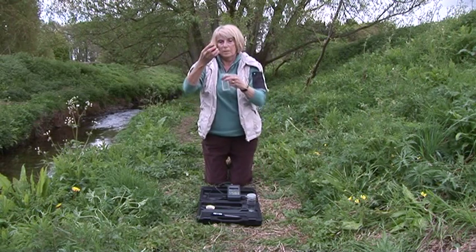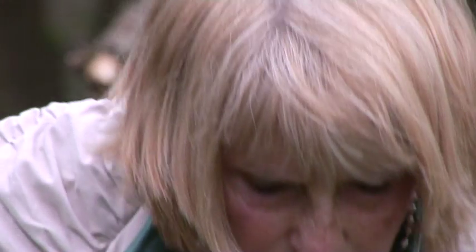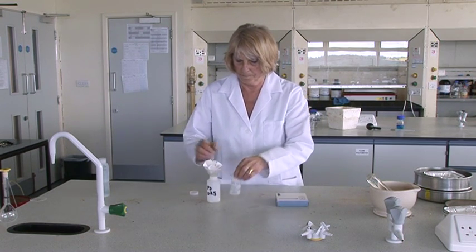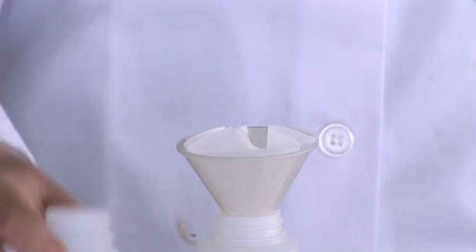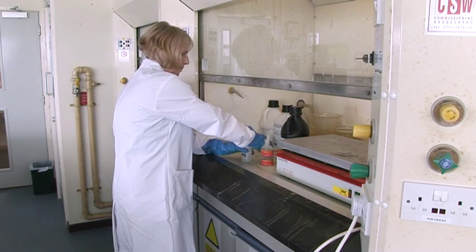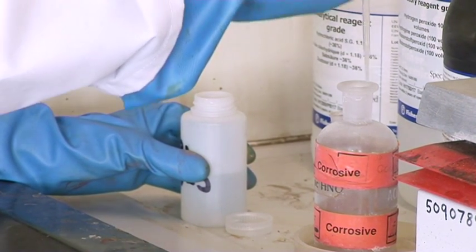A pH meter is used to determine the pH of the water sample. Heavy metals may be adsorbed onto particulate matter or other surfaces, therefore water samples must be filtered to remove any particulate matter. The acidification of the sample to less than pH 2 will prevent adsorption onto the walls of the container. The acid chosen will depend on the metals being investigated.